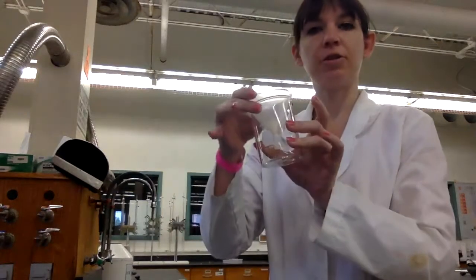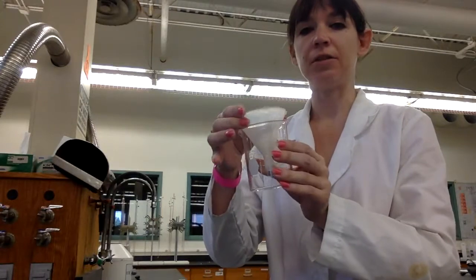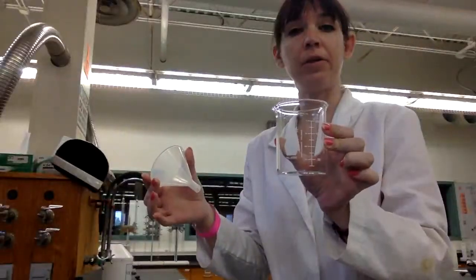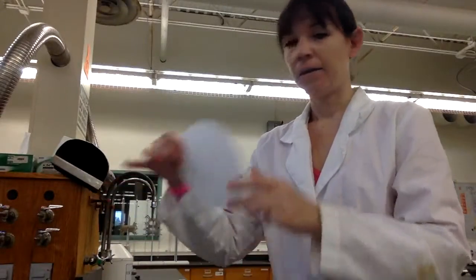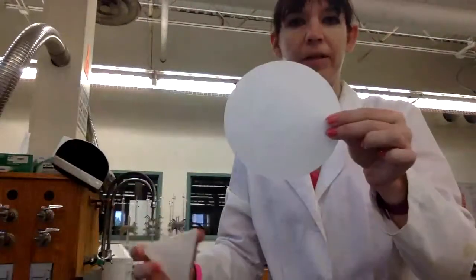I wanted to show you a quick video on filter paper. So on one of your labs, what you're going to be doing is some gravity filtration. So you're going to be having a beaker as well as a funnel. And you're going to get a filter paper like this.